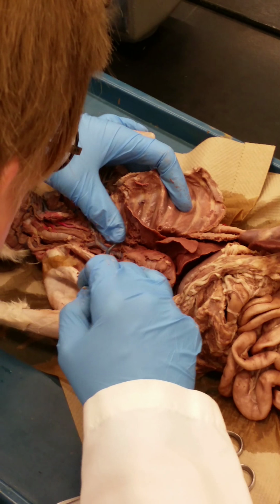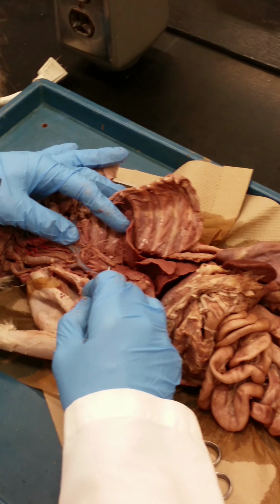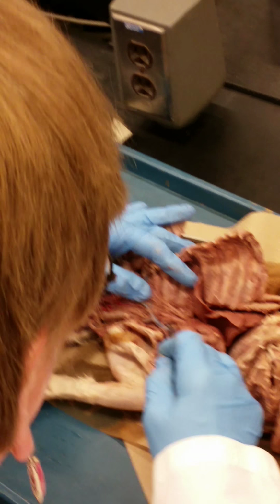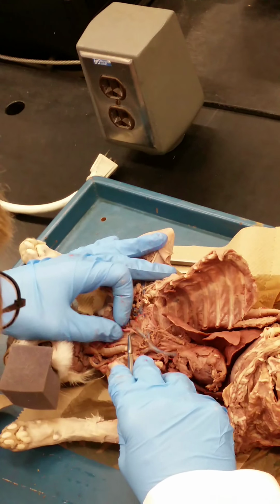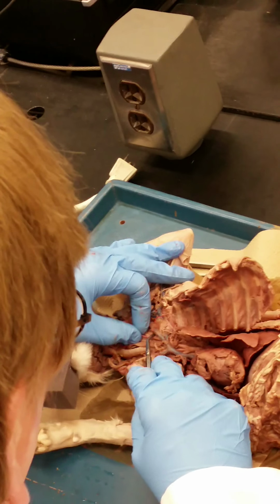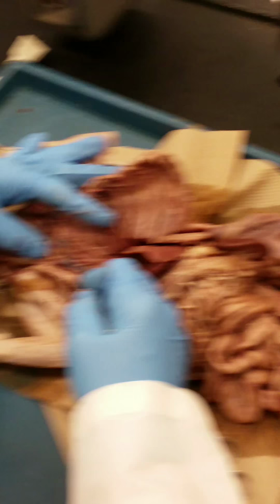Oh, this kitty's just lovely. My goodness. This is the best kitty I've seen in terms of being able to see very clearly that this brachiocephalic artery branches 3 times. The first branch here is the right subclavian artery, and these other 2 branches are the common carotid arteries, which you can easily follow up into the thoracic cavity and see that they are the common carotids. But this is one of the few kitties where the vena cava is not covering up the 3 branches so that you can't see them clearly, so that's very nice.